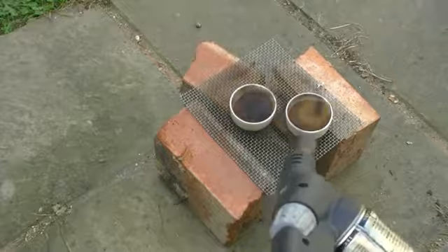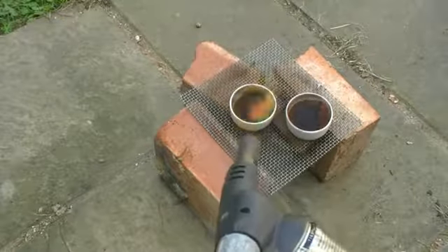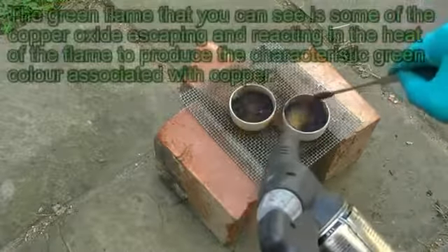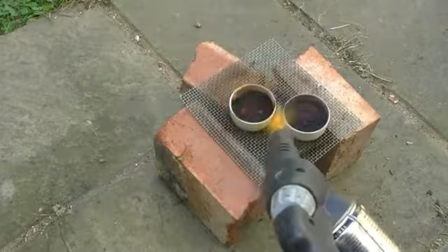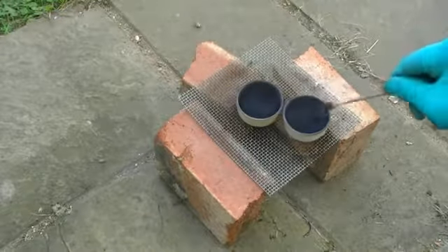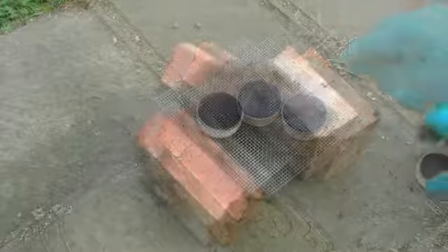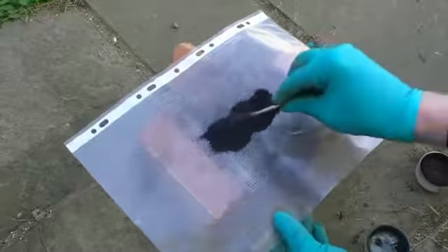If we stir our powder with a stainless steel spoon or spatula, this will help the powder come in contact with air or oxygen. After about 3 to 4 minutes of heating, we switched our gas torch off, allowed our powder to cool down back to room temperature, and let's see what we've got. If we empty our dish, we can see the powder is black in colour, and this is what you would expect for copper(II) oxide.